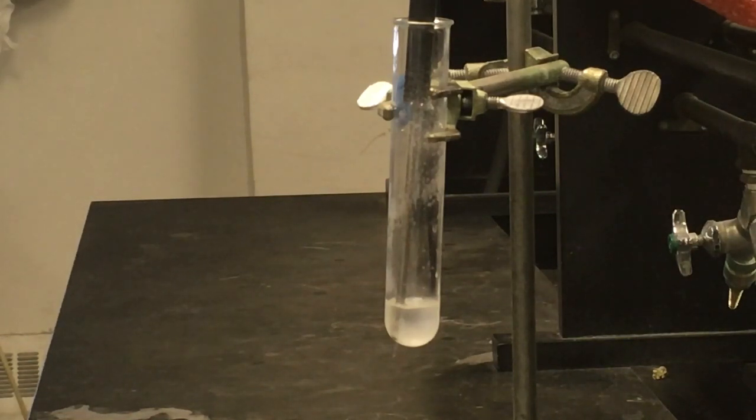You can actually start to see the solution solidifying pretty quickly here now that it started to turn. And so I'll let this go for another minute or two here while it finishes freezing all the way. And then, like I said, I'll present all of the data and show all the data for everyone at that point.